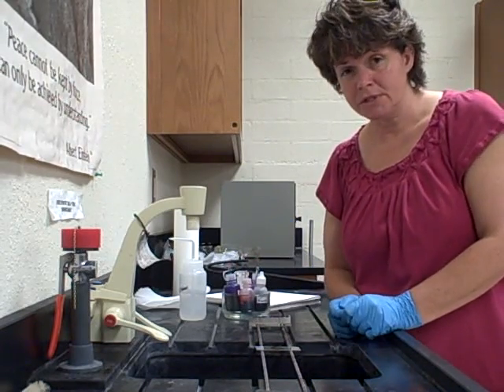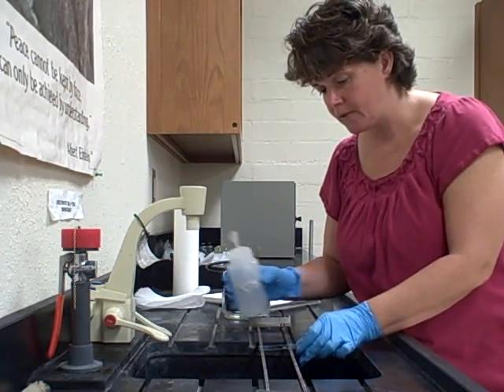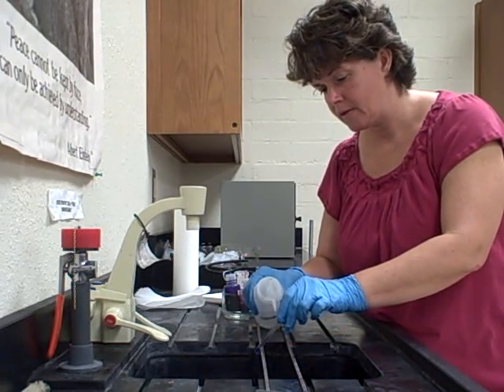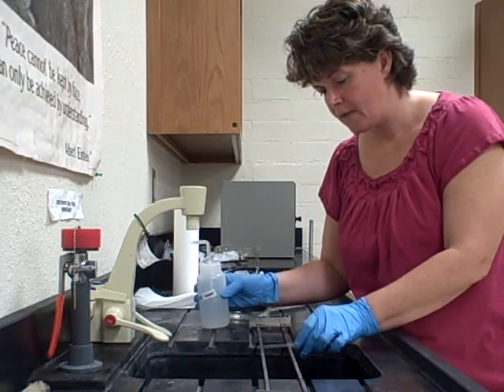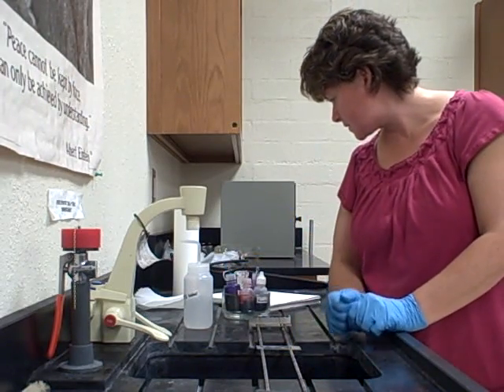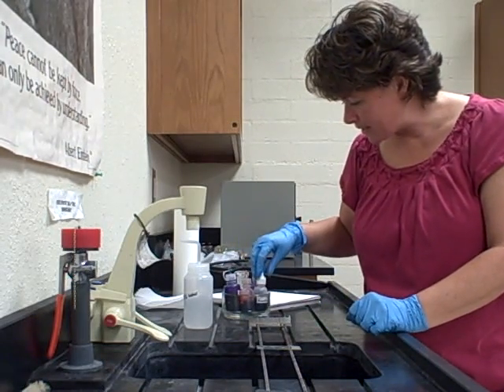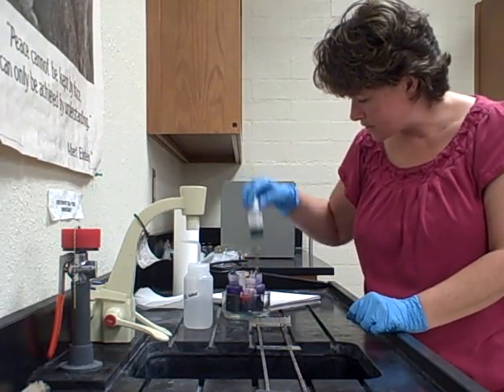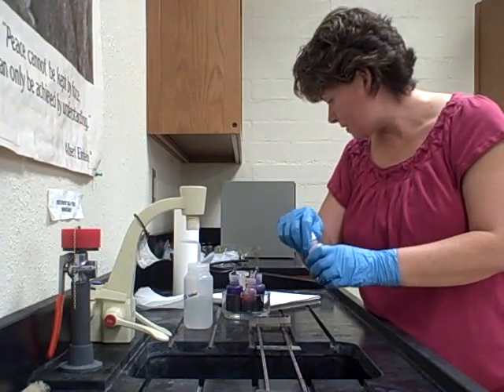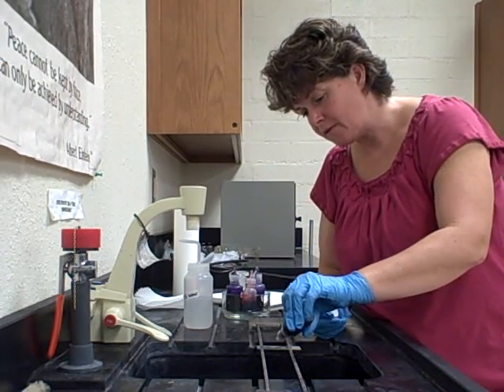After waiting 30 seconds, you're always going to rinse between steps, so use your water bottle and rinse. The next thing it says to do is put the gram's iodine on — that's this one right here — and it says for about 10 seconds.